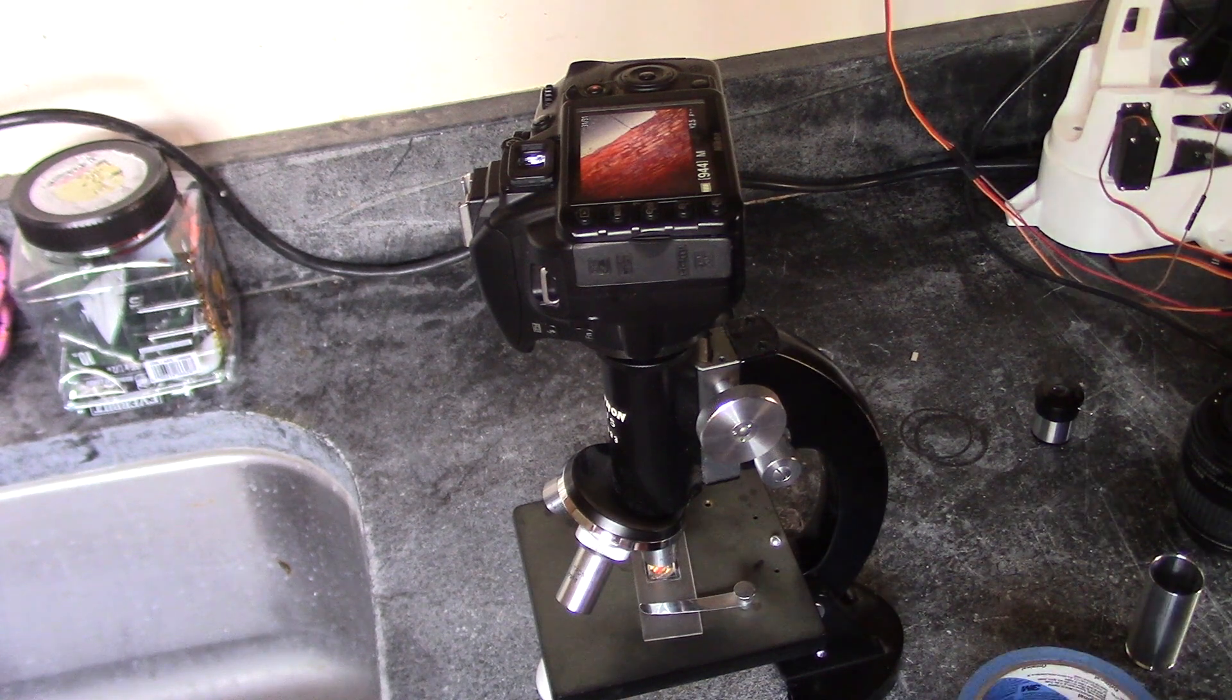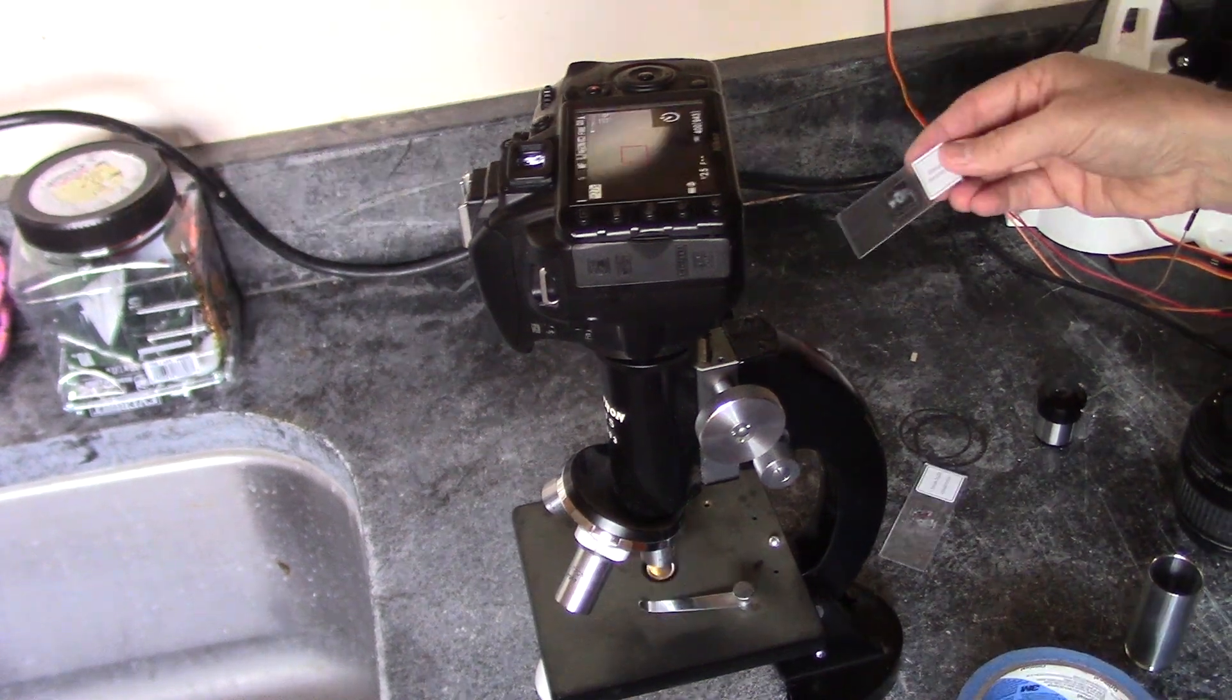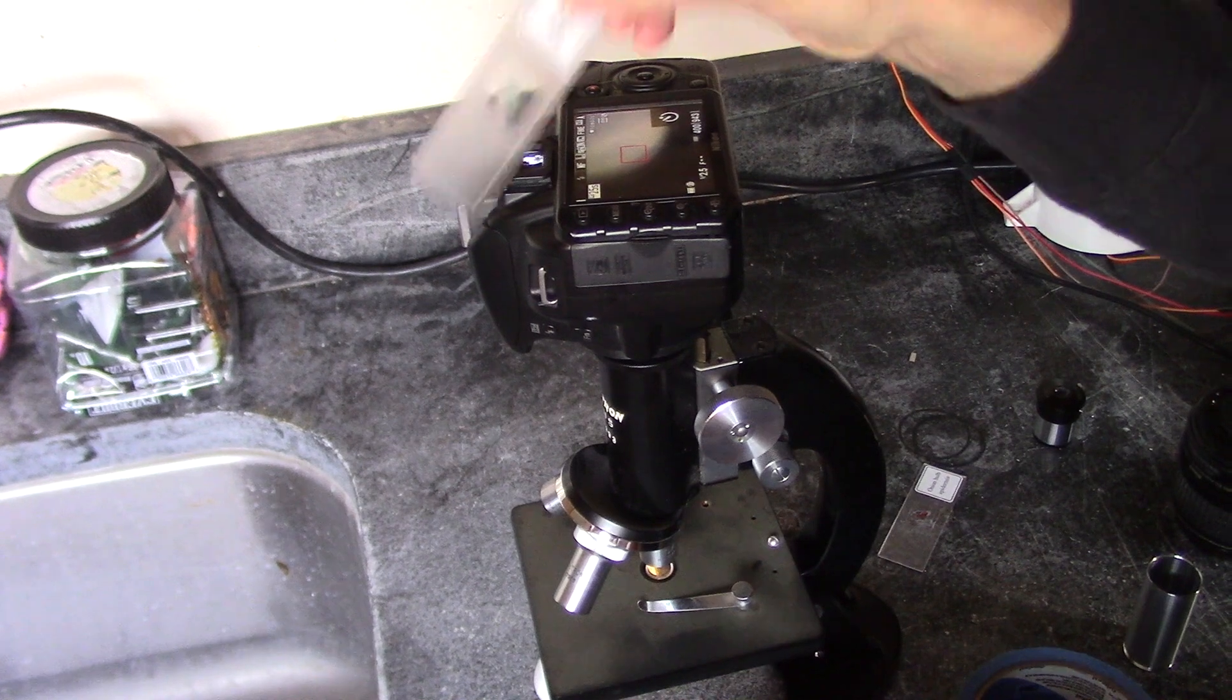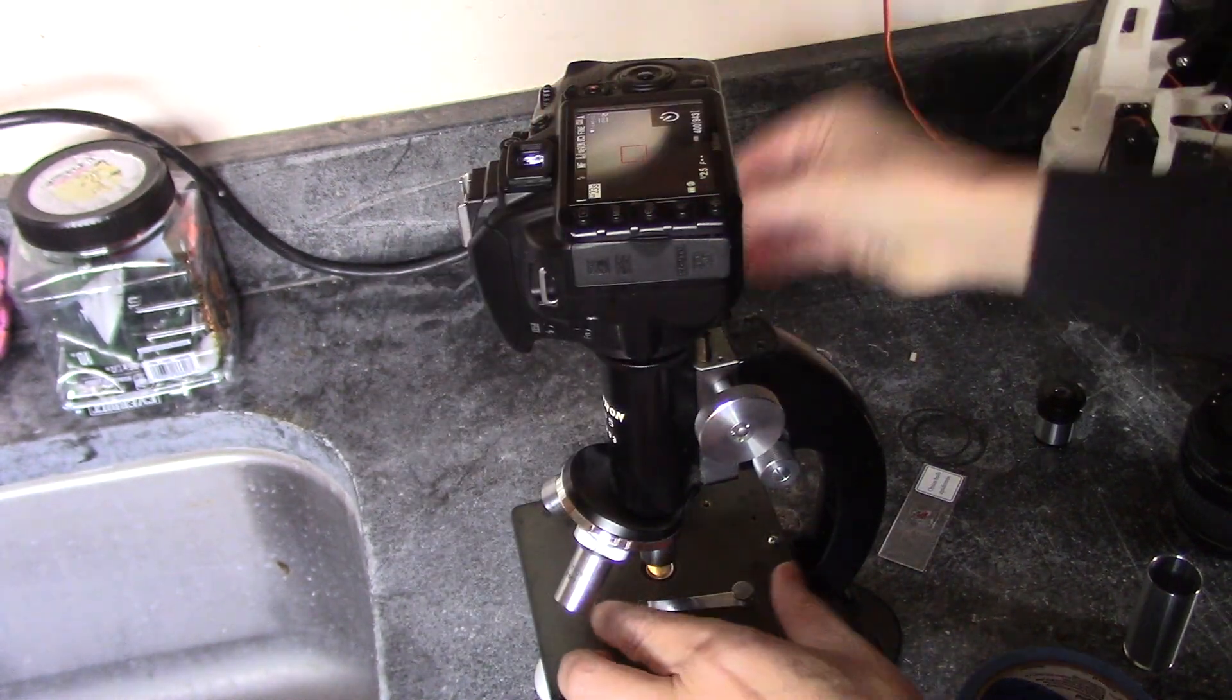Okay, all right, well, let's take a look at something else. Okay, so I've got a broad bean leaf here, see what we can see.